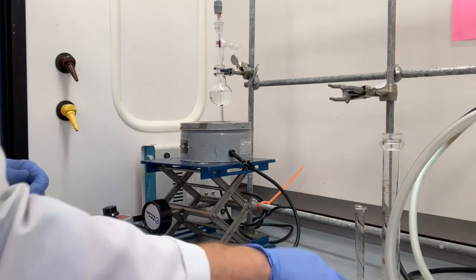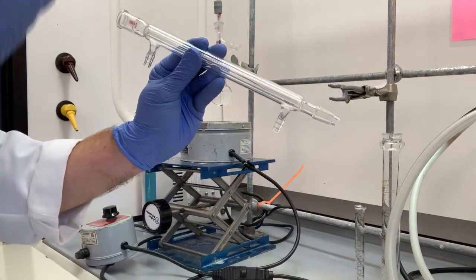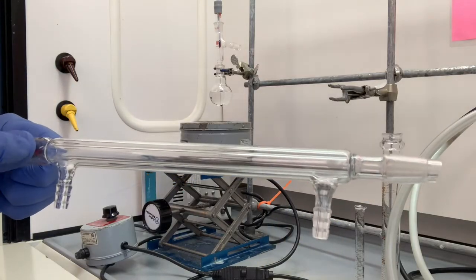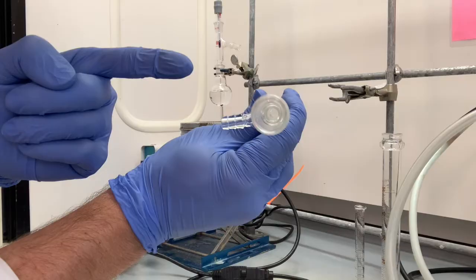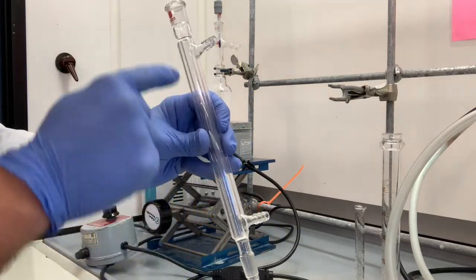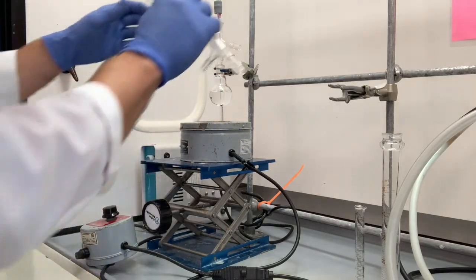All right, now we will use a condenser. This is the piece of glassware that provides cooling to the system, and it takes that distillate in the vapor phase and condenses it back to a liquid phase. If you haven't seen a condenser before, it's really important to consider how this looks. There's an interior tube that goes right through here. Then there's an exterior jacket. That exterior jacket is where the water will flow. We're going to flow water through one of these inlets and then out the other inlet. We're going to talk about which way the water comes in in just a second.